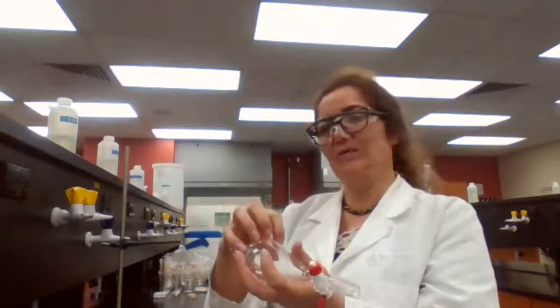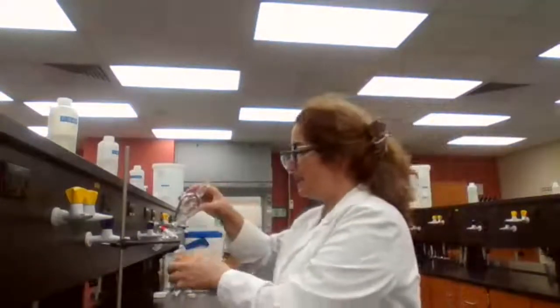If you do really hard shaking, you are going to warm up your solution too much, and sometimes your ether, your solvent, is actually vaporizing, and the new gas that is coming out is the vapor of the low boiling point organic solvent that you have in there. So 2-3 times shaking and venting is good enough. After you add your solvent, you shake it first. Then you vent it. That's V-E-N-T, venting, which means releasing the pressure. And the last step is to separate.